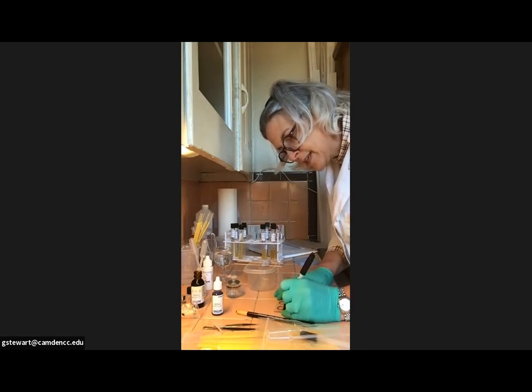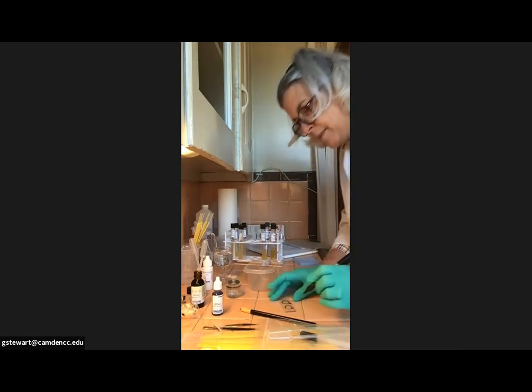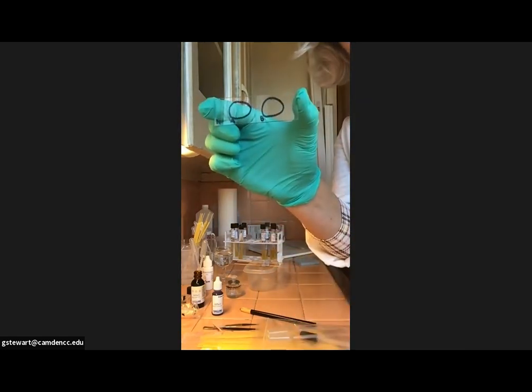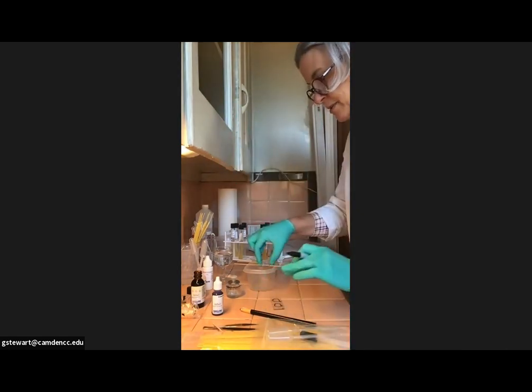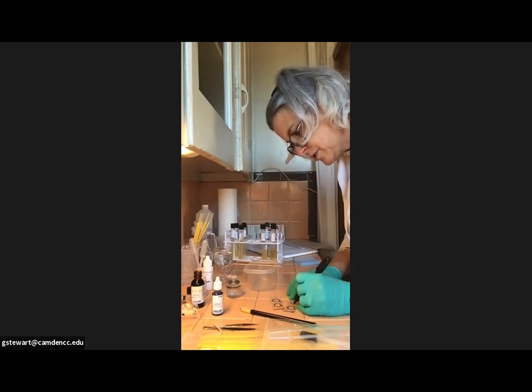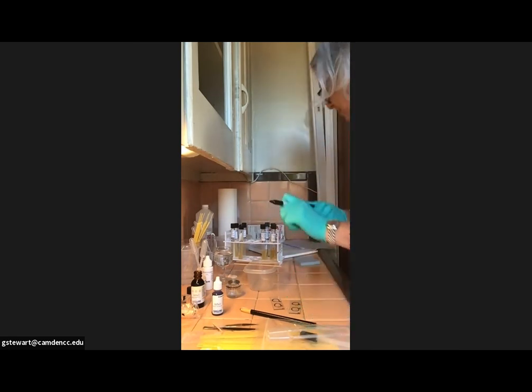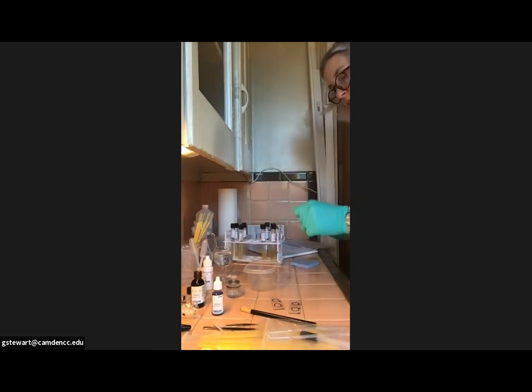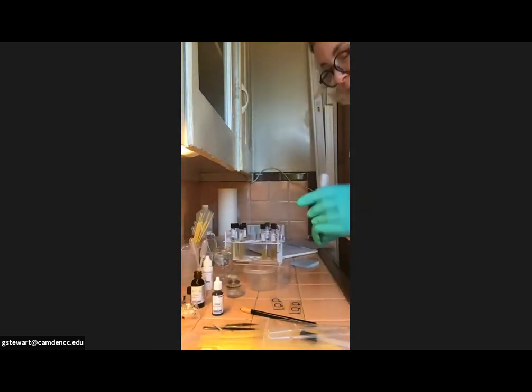They ask you to label this slide 1 and A for your first circle, B for your second circle. So like that. And then the second slide, I'm going to do the same thing. I'm going to label it slide 2 in the lower left-hand corner. I'm going to draw 2 fairly large circles. And again, label one of them A and the second one B. This will help for how you need to draw the pictures in your notes.